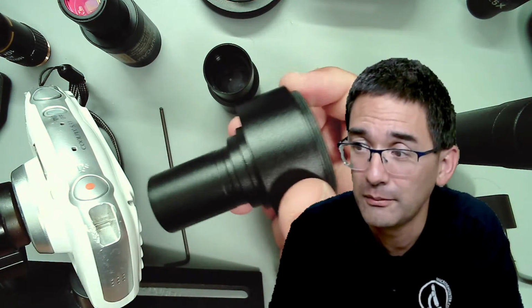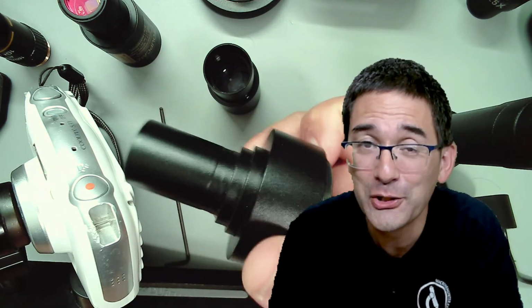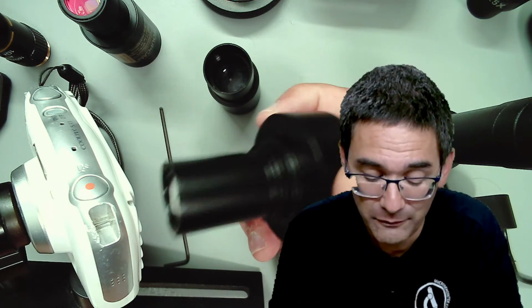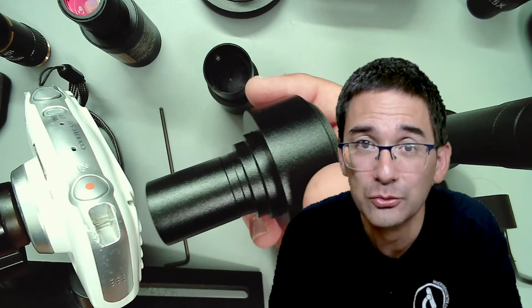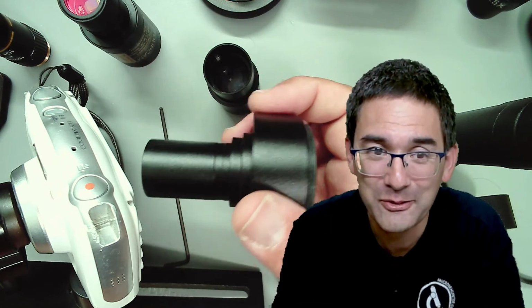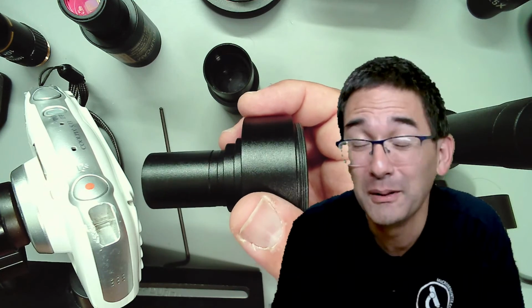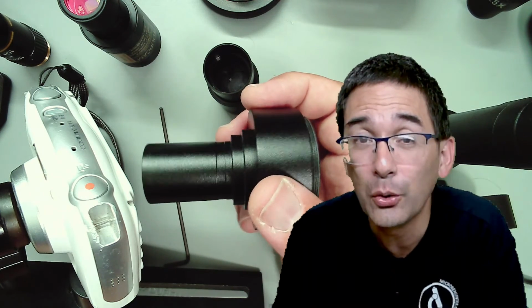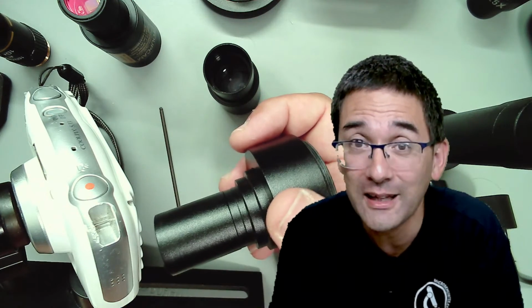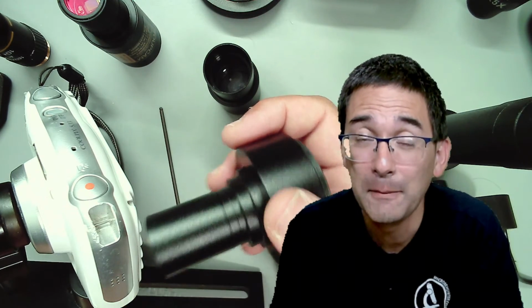Or you try a self-help system by 3D printing adapters. Yeah? If all of this stuff is really too annoying, trying to find the best solution. But if you have a little bit of money, you go to the big 4 microscope manufacturers: Olympus, Nikon, Zeiss, and Leica, the big ones.